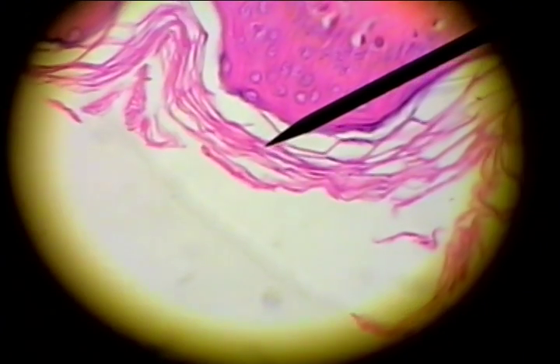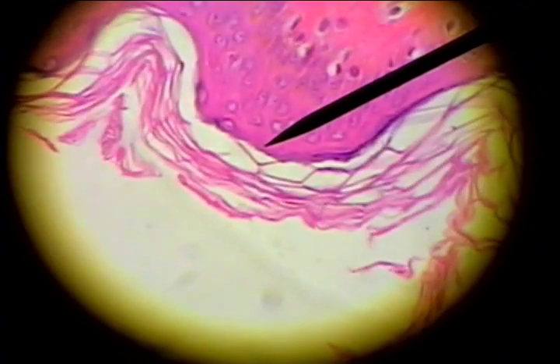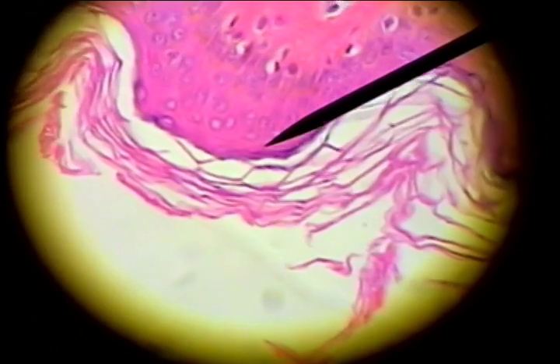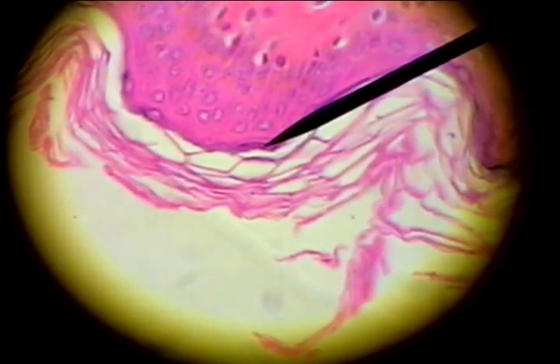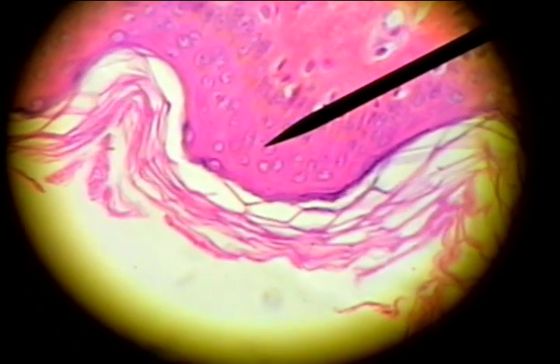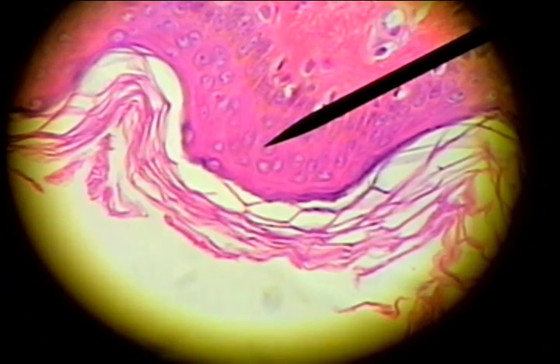Below the stratum corneum is the stratum granulosum, and then below that the thickest layer of the epidermis, the stratum spinosum.